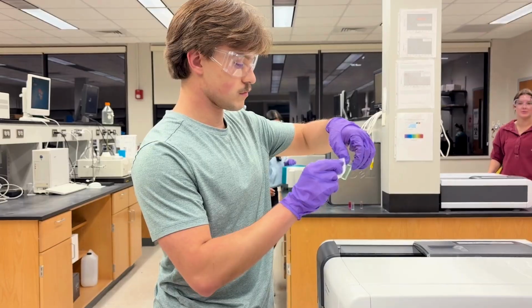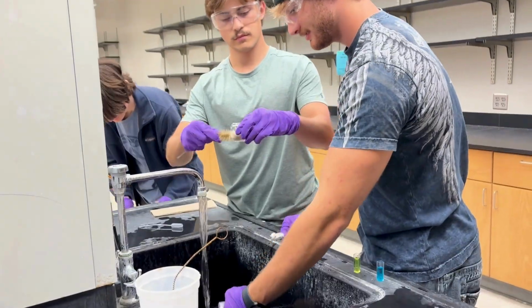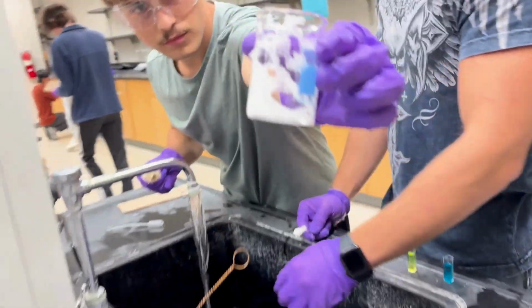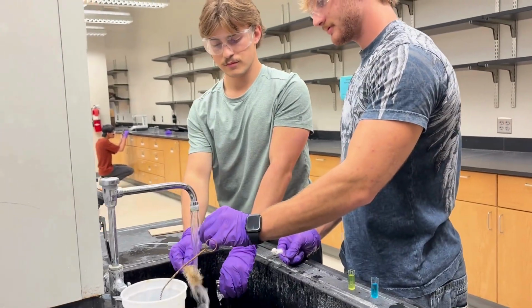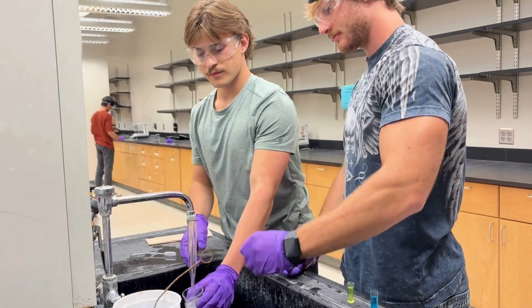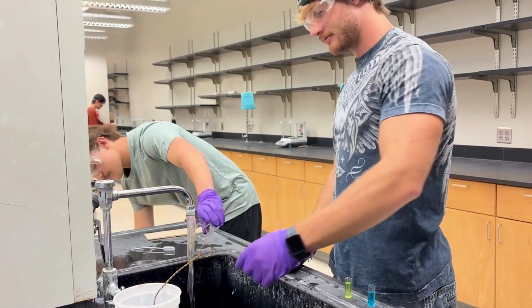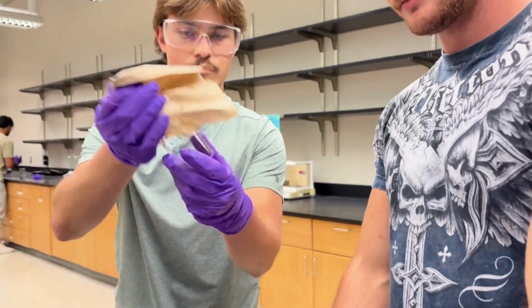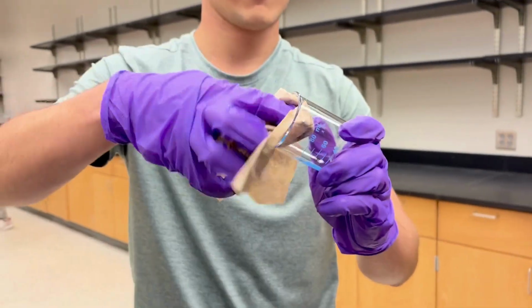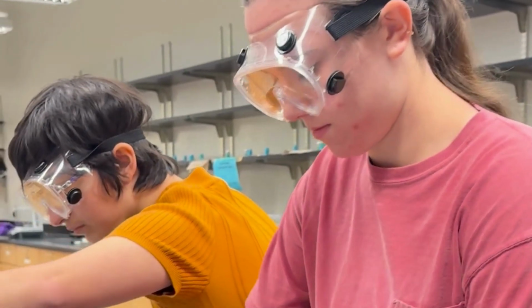If we fail to zero the spectrophotometer using a blank, our absorbance values would be higher than they should be, leading to inaccurate concentration calculations. The molar absorptivity is a constant specific to the compound. The path length is measured using the cuvette, and concentration is what we are calculating from the absorbance. This ensures we can relate absorbance to the actual concentration and verify the accuracy of our measurements.